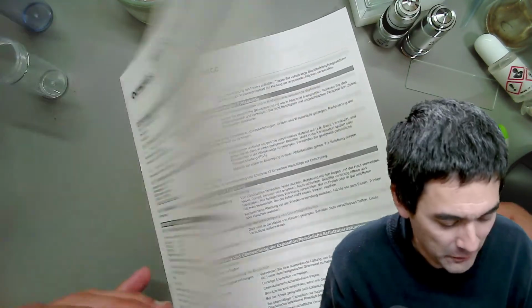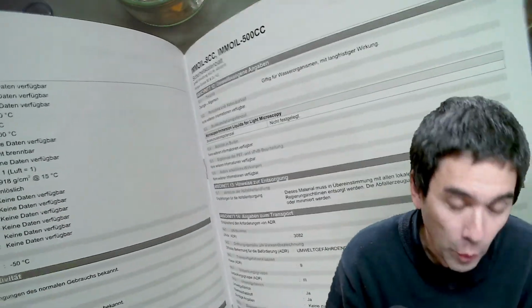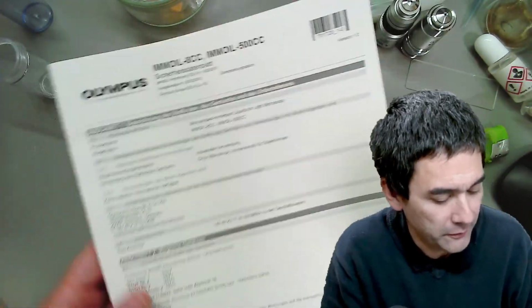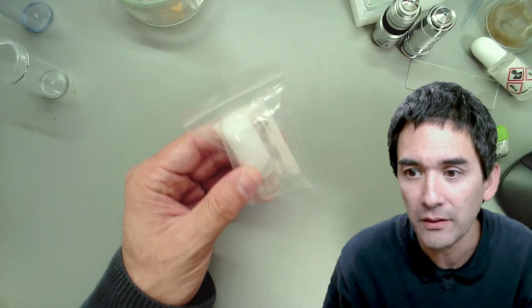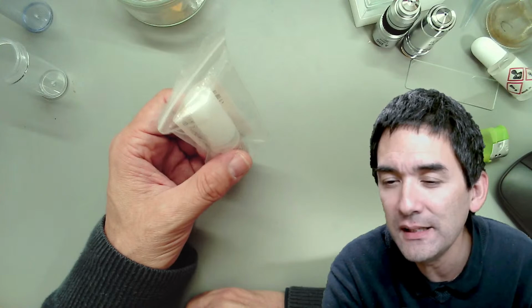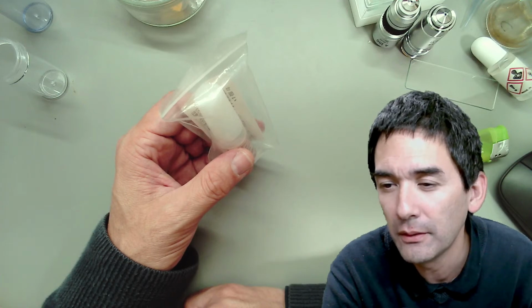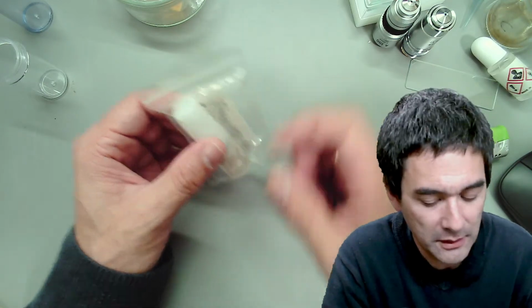But when I contacted the company, I asked, is it really that dangerous? They said no, but there are a couple of chemicals in there, just like with any other substances, where you just have to know it. And they simply document everything very well, okay? So I just wanted to show you that some of the companies really go to great lengths in documenting everything. Another one, Zeiss, has a series of lenses that work with oil, glycerin, and water immersion. Even on eBay they're very expensive, though very sharp. So there are companies that actually do that.